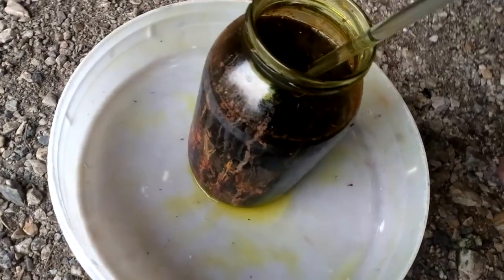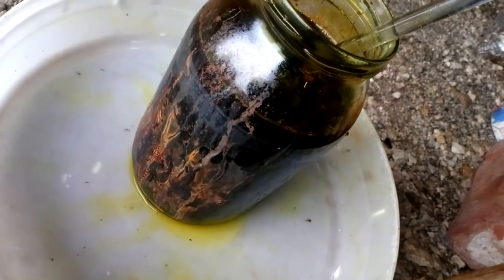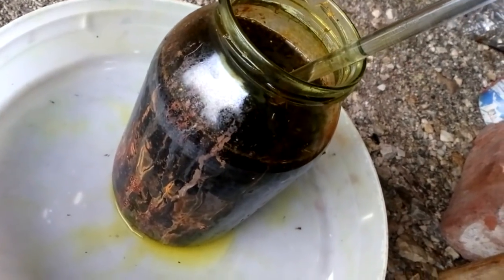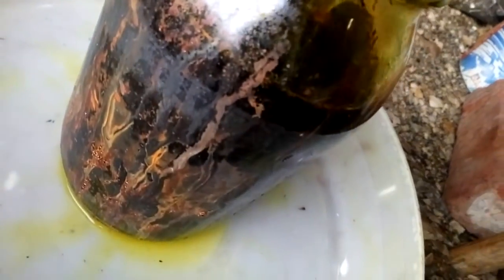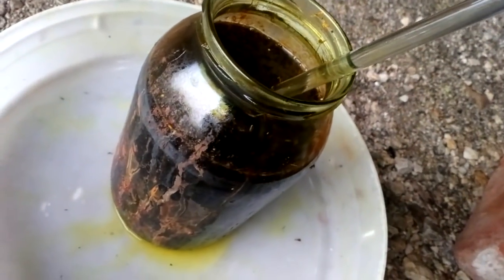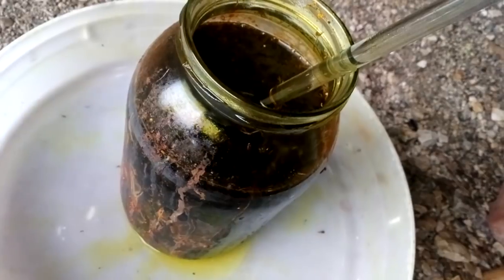Okay guys, the job is finished. After the beginning, I added HCl and nitric acid slowly, little by little. I watched that it didn't boil, but I had some boil-over the edge. I will collect that from the bottom. Now the next step is to add urea and drop some gold.